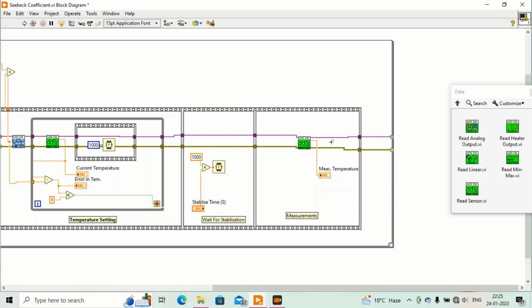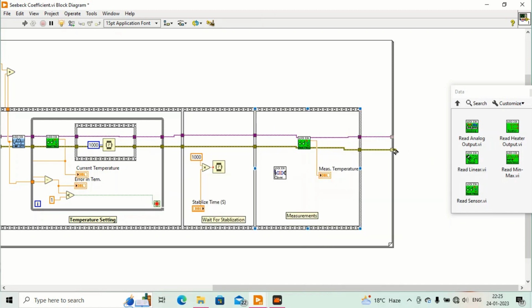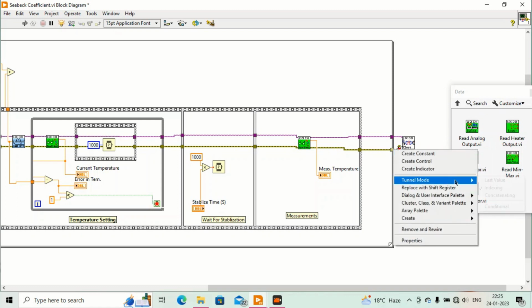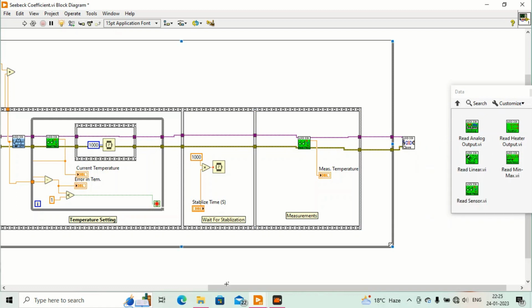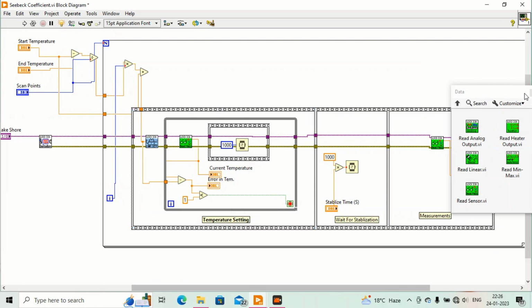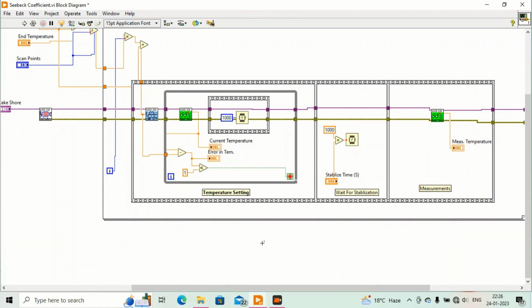Now we have to close this temperature controller, so I will put close VI here. Okay, so we have put all the things for temperature setting, for the temperature controller. Now we will try to make measurement with digital multimeter for Seebeck coefficients.